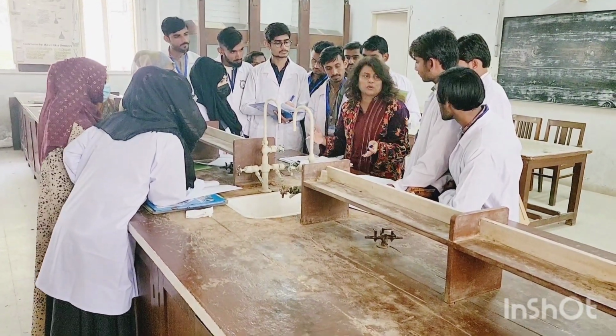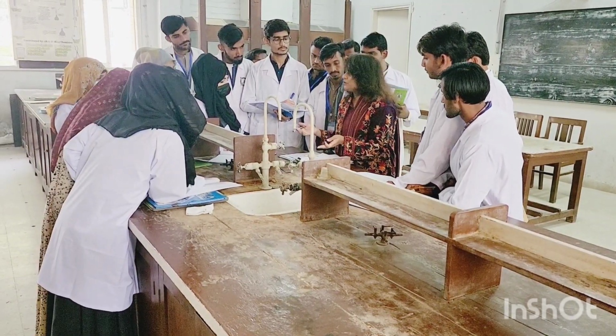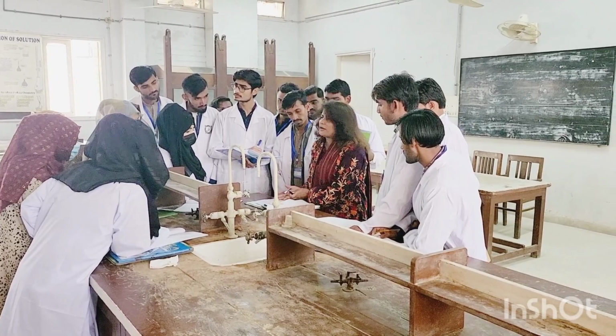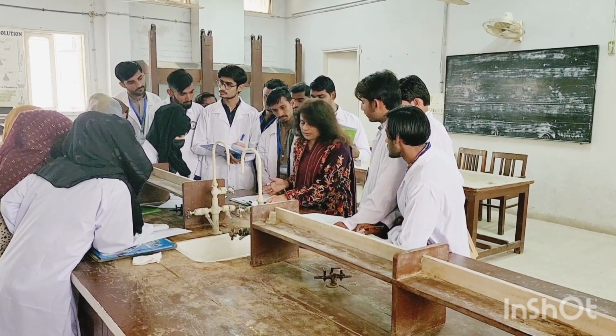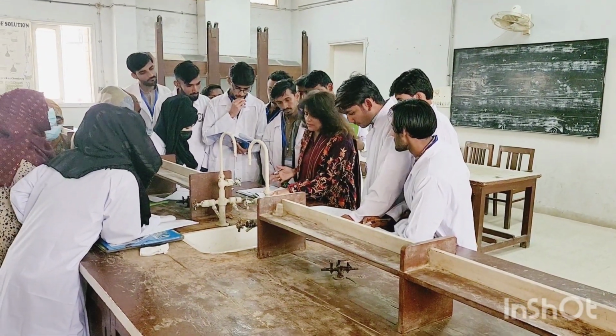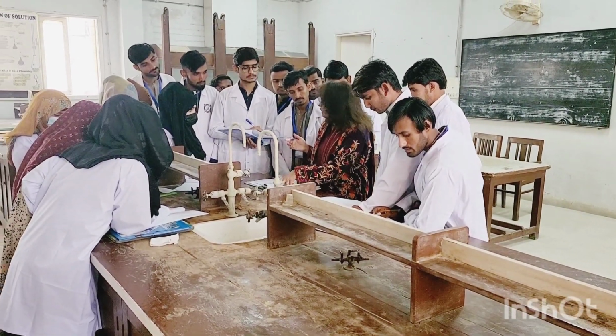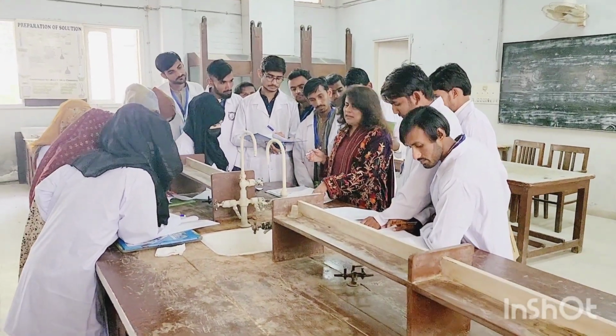It will give you some sort of a test, some sort of a change. You will see, you will find in your litmus paper. So you will write down accordingly. Blue litmus paper turns to red, acidic in nature. Red litmus paper turns to blue. They have given us the option. You will select the option. You will move forward. Ignition test.